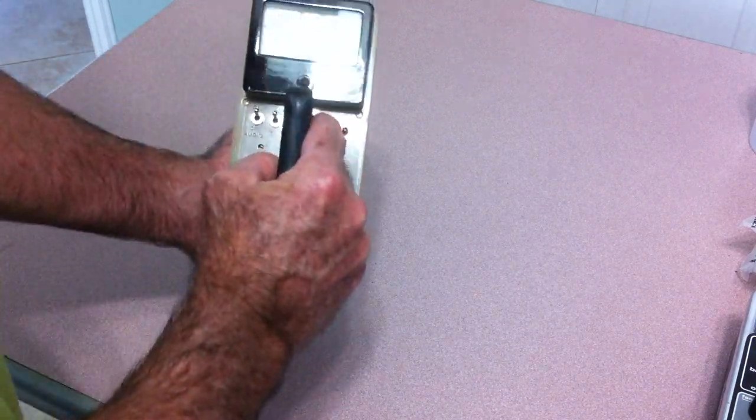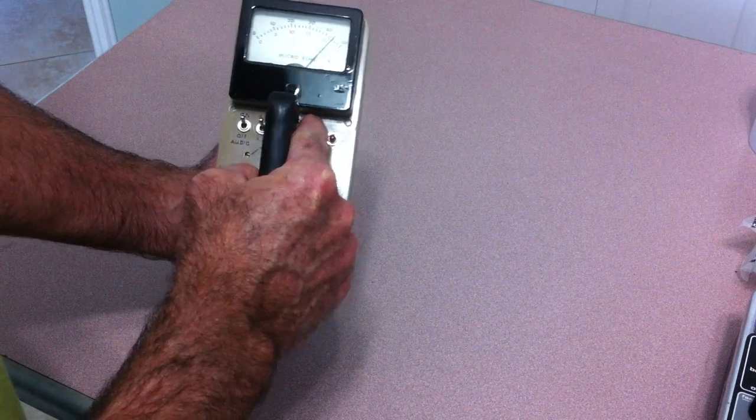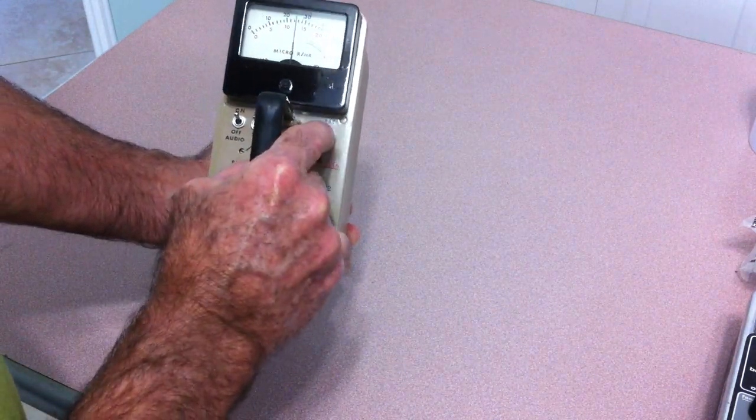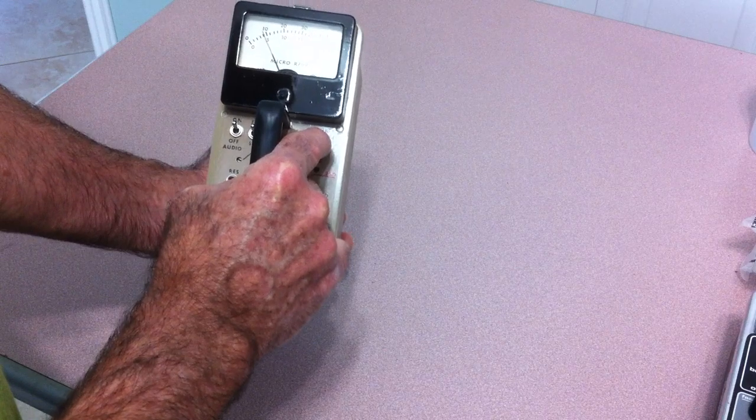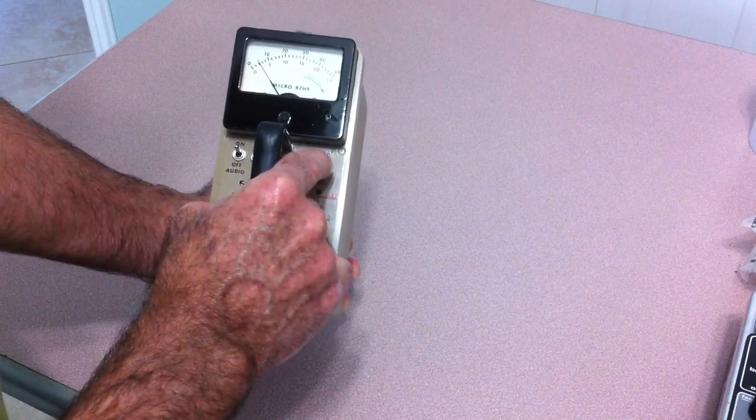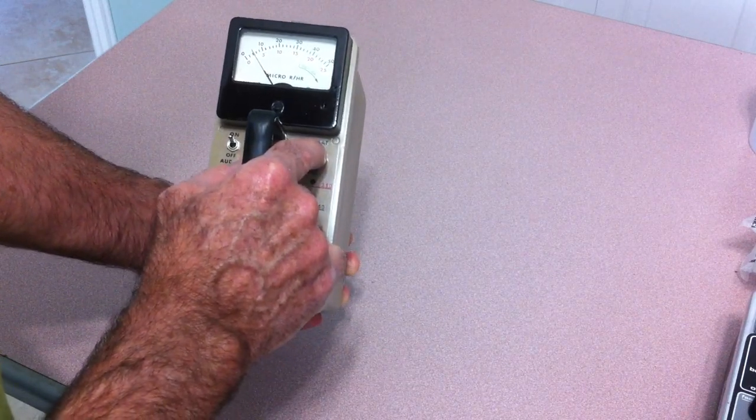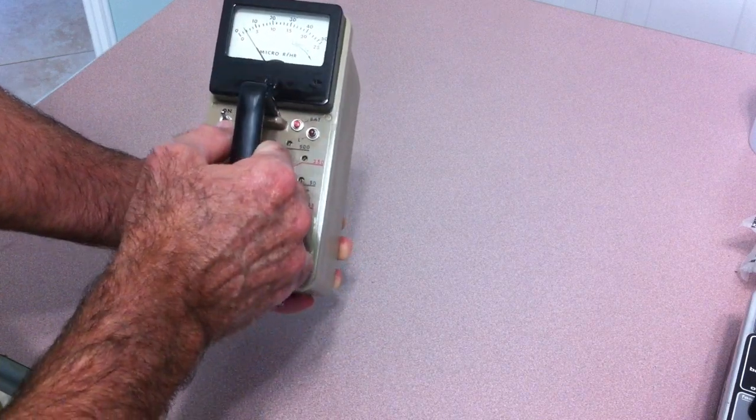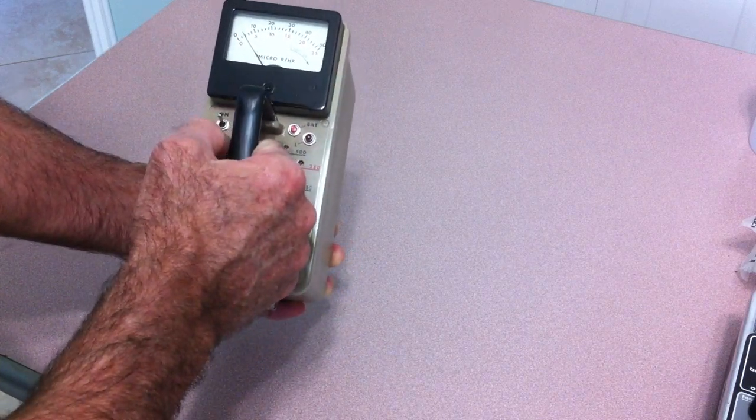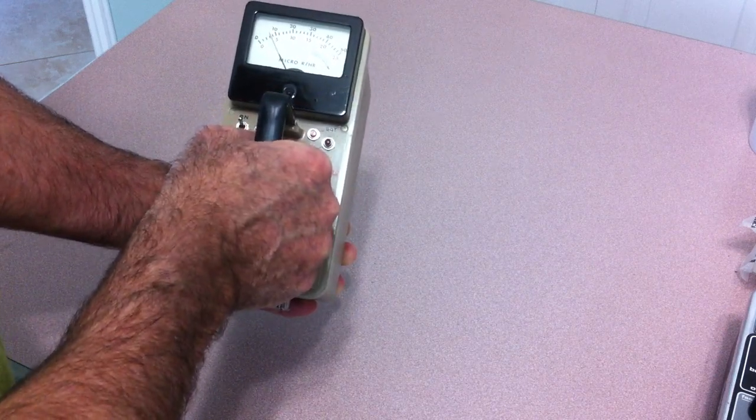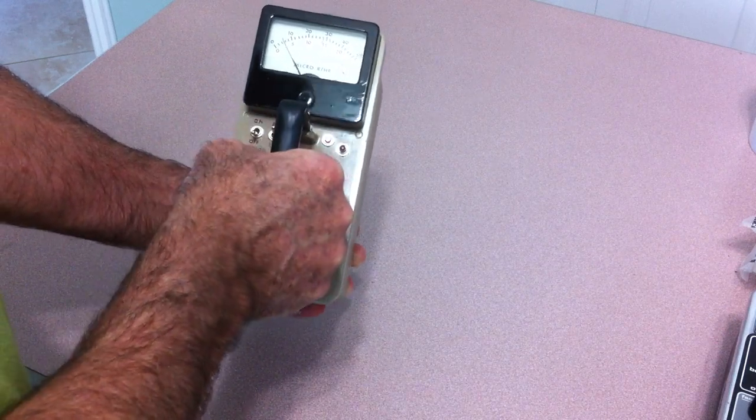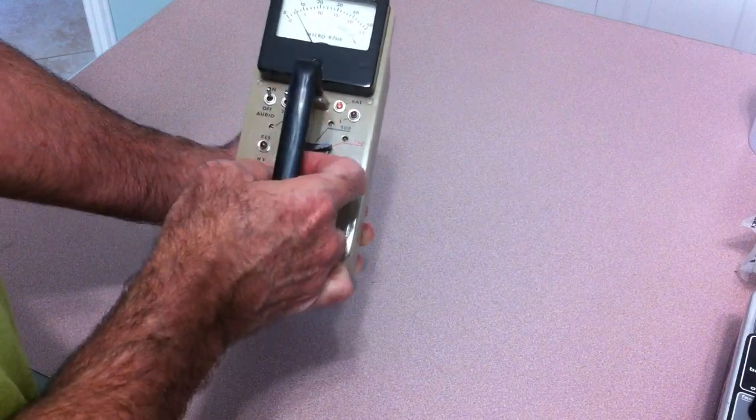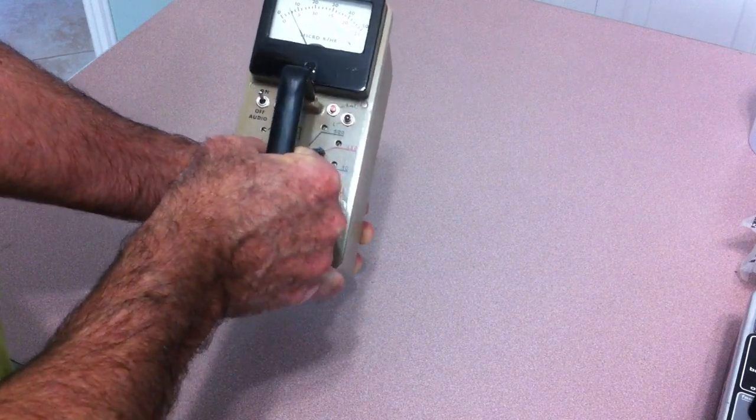The battery check button has a light source for the meter. You probably can't see that in this light, it's a little bit too bright in here. I can see it fine here, but if it was in a darkened area I'm sure even the video would pick it up. It has the working fast-slow response switch and an audio on-off switch as you can hear is working fine.